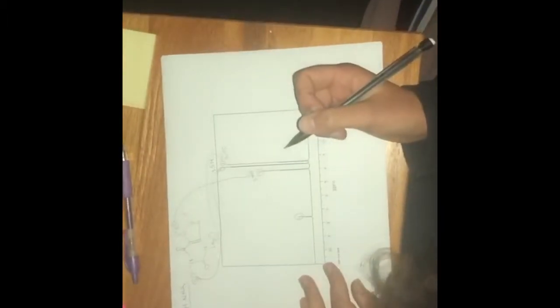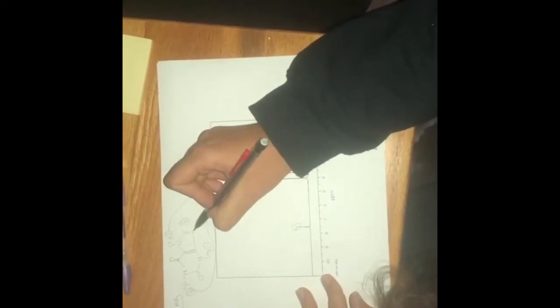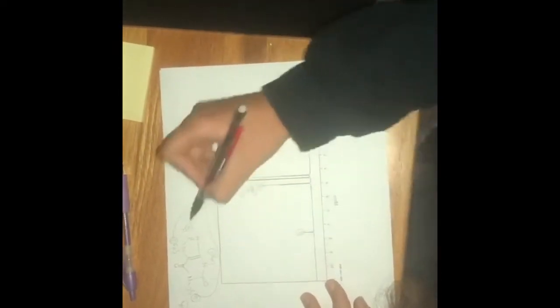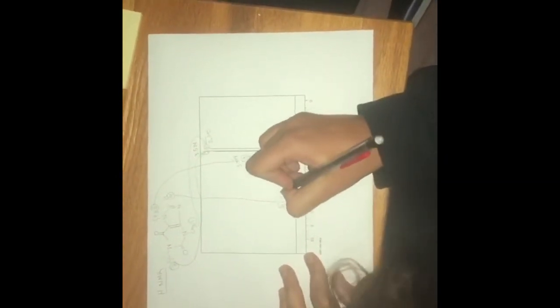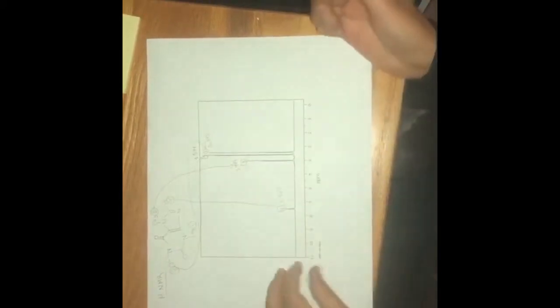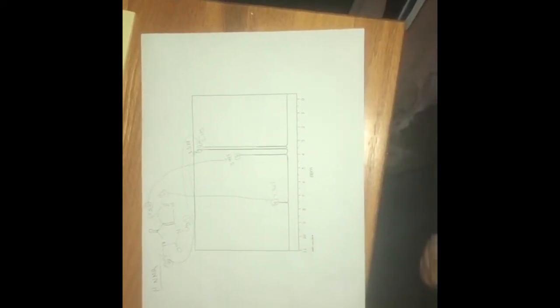And then the last region of hydrogens is this hydrogen right here, the most deshielded, which is probably due to these two nitrogens and these two rings right here, shielding it from the rest of the molecule. And so that's going to be here, and that's at 7.527 ppm. And that's all.